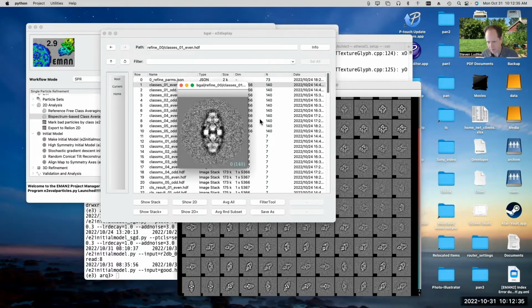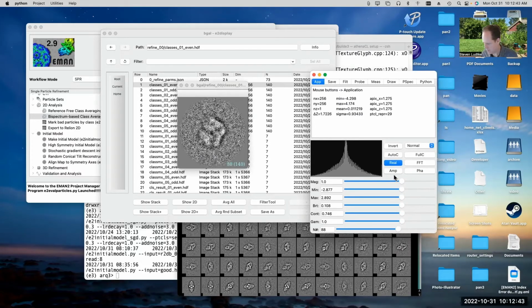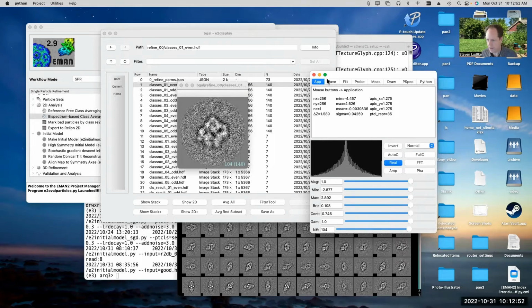If I middle click, I could also use the N slider, oops, the N slider. Oh, hey, I'm having that bug again. All right, that's another Mac specific thing.